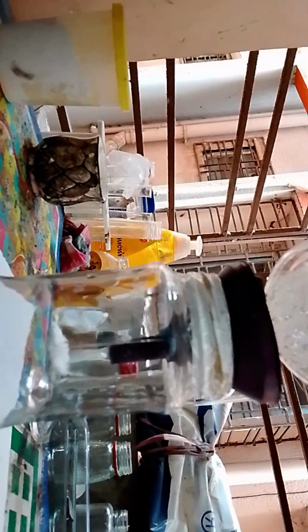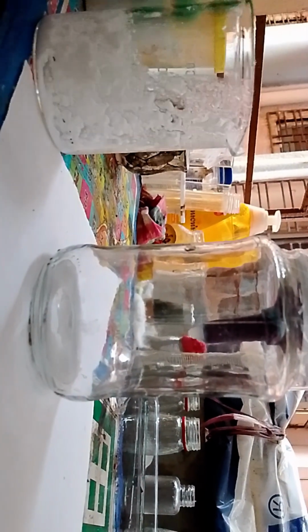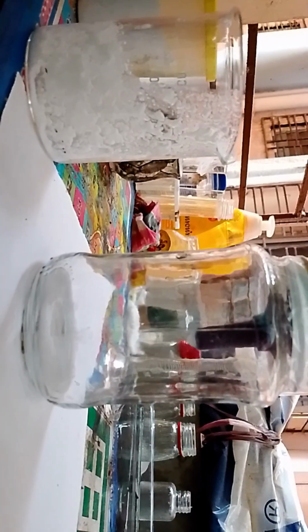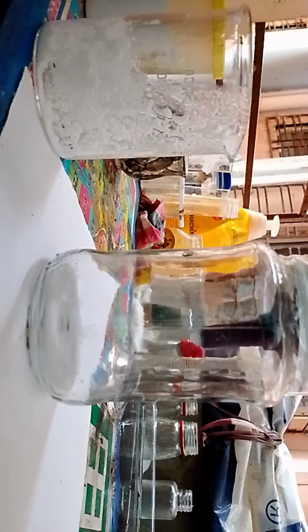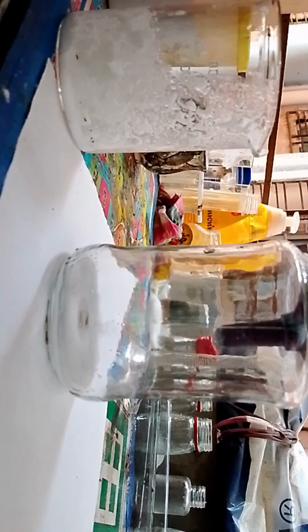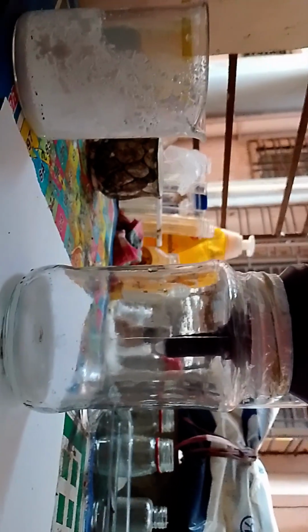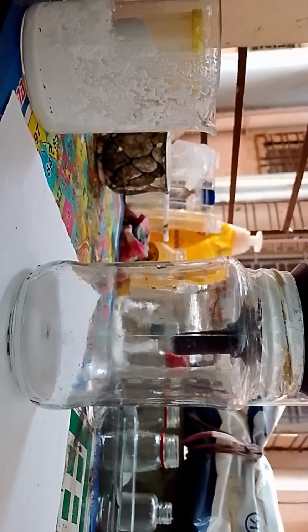Okay, I think I'm getting a milky liquid. This is not a good sign. Yes, that's a milky liquid. Not at all great. Okay, let that filter while I wash the beaker with a little bit of water. And I will also add a little bit of sodium hydroxide from my previous video.